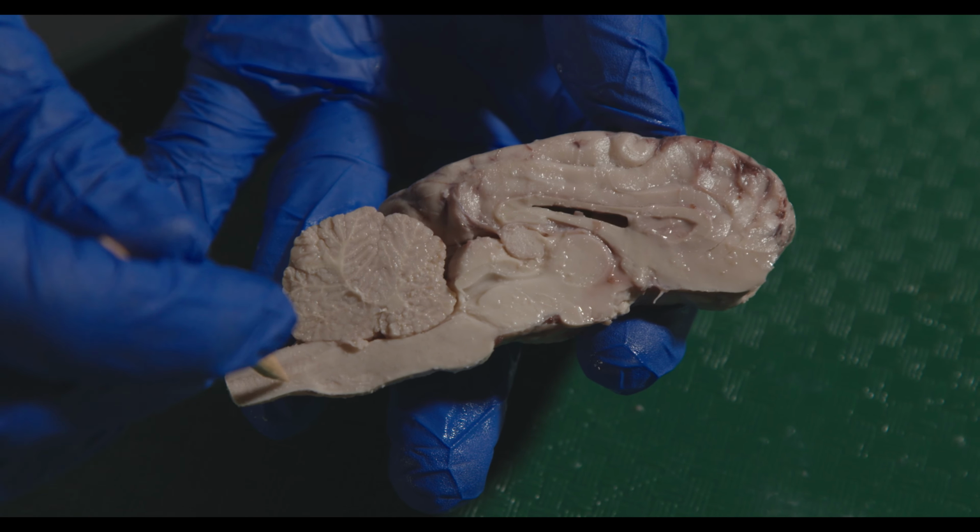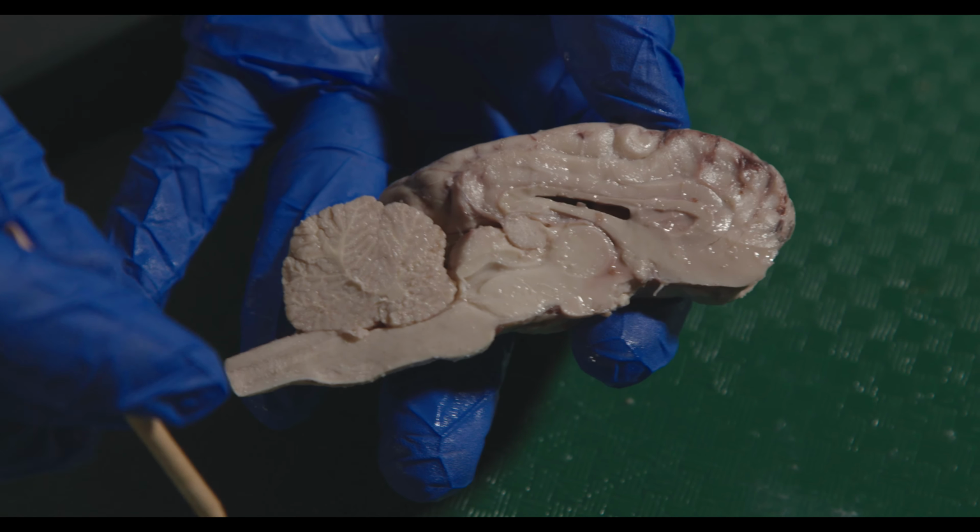You can see the cerebral aqueduct here, which essentially is the ventricle structure that's going from the third ventricle, the cerebrospinal fluid that's flowing down through the cerebral aqueduct down to the fourth ventricle, which is this little cavity found just underneath the cerebellum. We can also see the midbrain, which is up here, and then the medulla, which is just post the pons. And then, of course, down here, this is where it starts to become spinal cord.